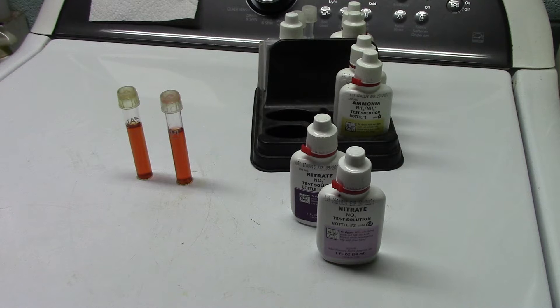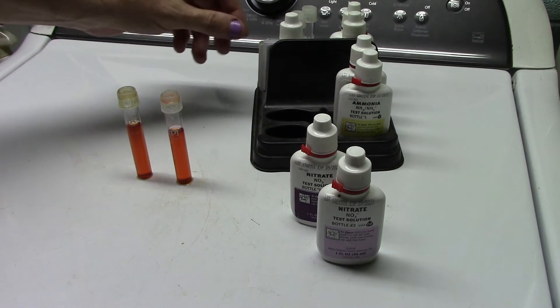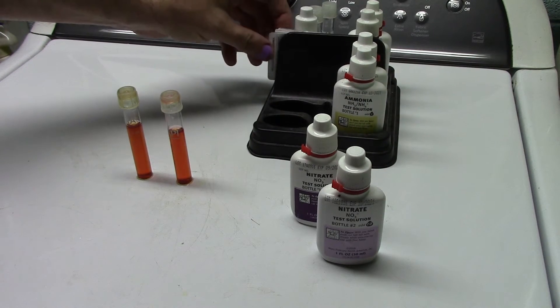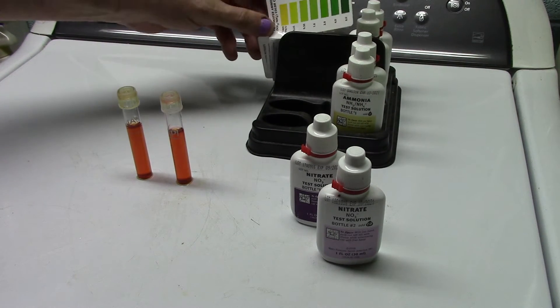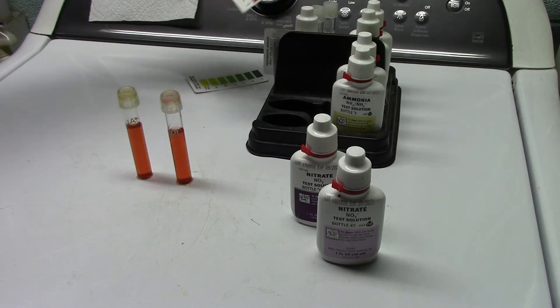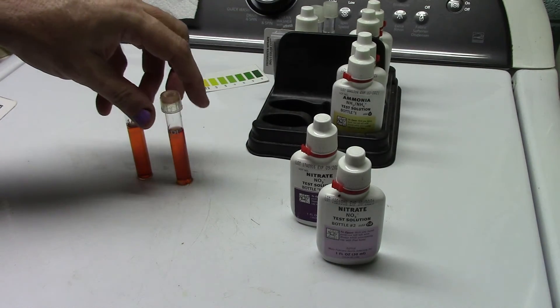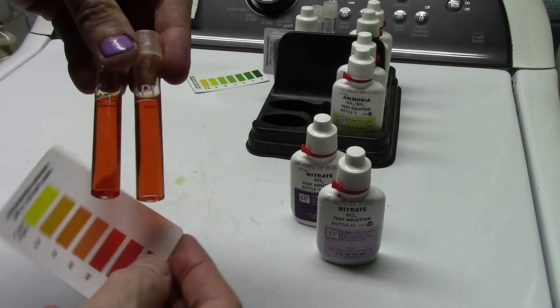I don't know if you've heard that or not, but squeaker is saying hello. So it doesn't really matter whether, you know, what we actually see on the card here. Let me find one of these cards, it's actually a nitrate card just so we've got the right card.